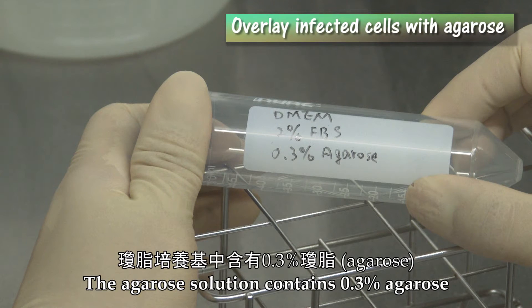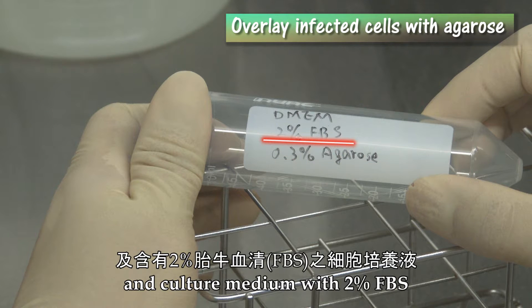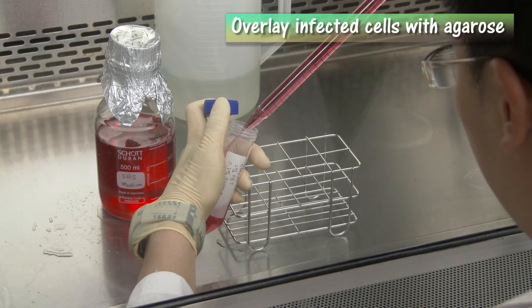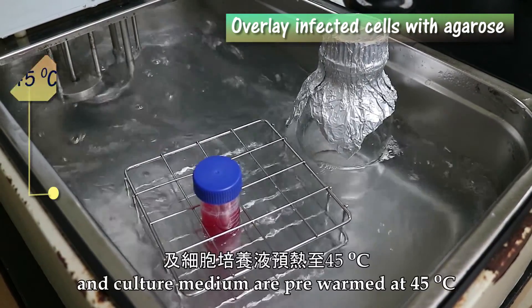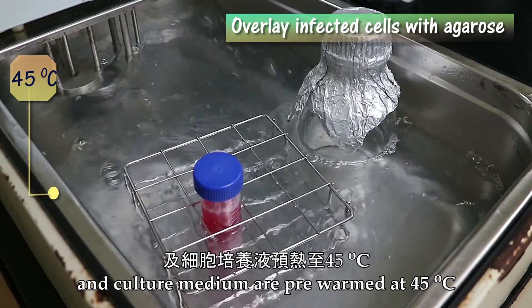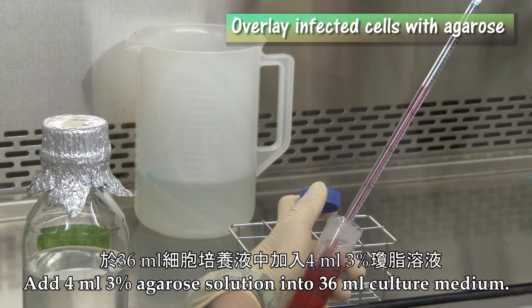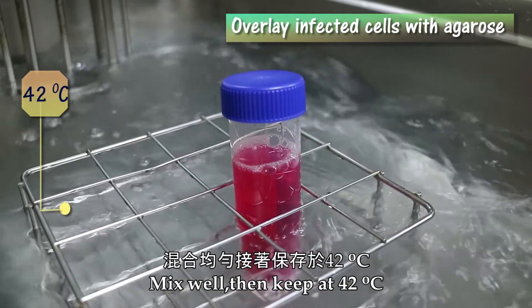The agarose solution contains 0.3% agarose and culture medium with 2% FBS. Autoclave the 3% agarose solution, and pre-warm the agarose solution and culture medium at 45 degrees Celsius. Add 4 ml of 3% agarose solution into 36 ml of culture medium, mix well, then keep at 42 degrees Celsius.